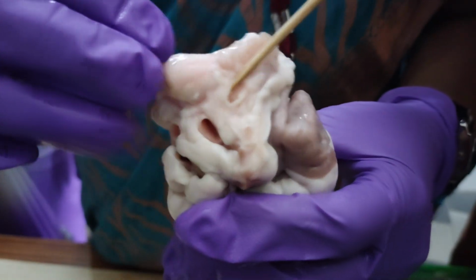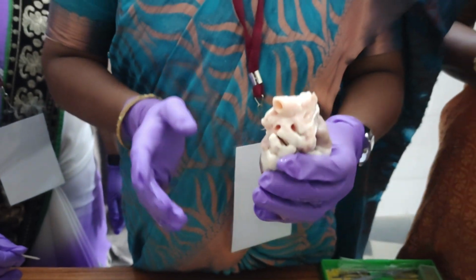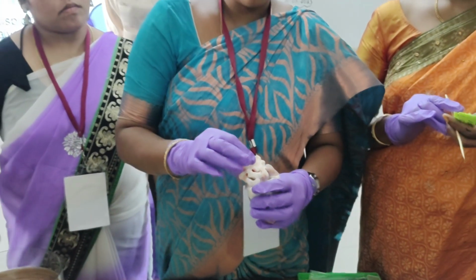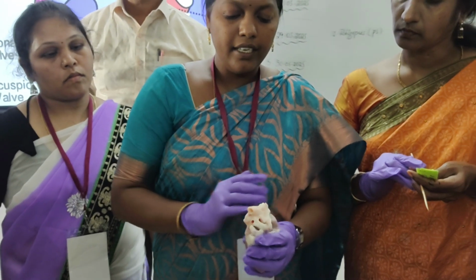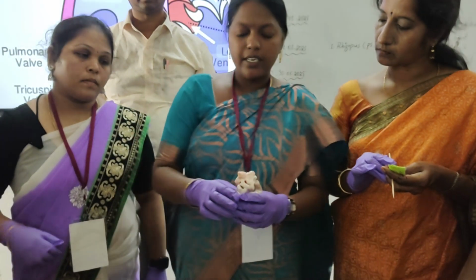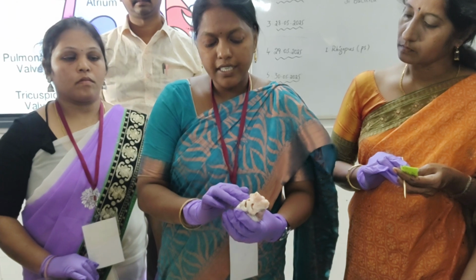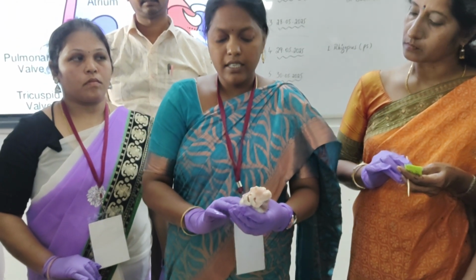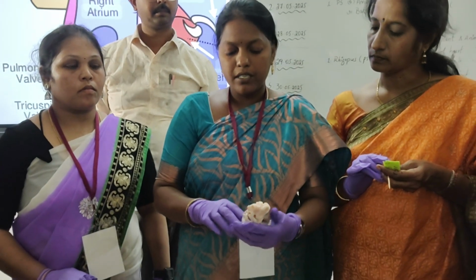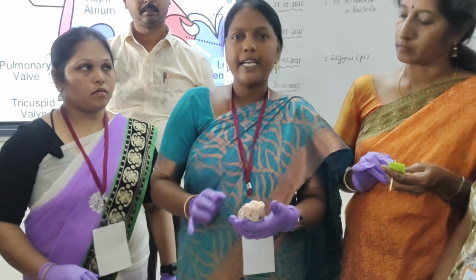The aorta collects the blood from the left side to all body parts except the lungs, and the pulmonary artery collects the deoxygenated blood from the right side of the heart and transports it to the lungs for oxygenation. From the lungs, pulmonary veins bring the oxygenated blood to the heart, and again the heart distributes oxygenated blood to all body parts. The whole process is completed within 0.8 seconds.